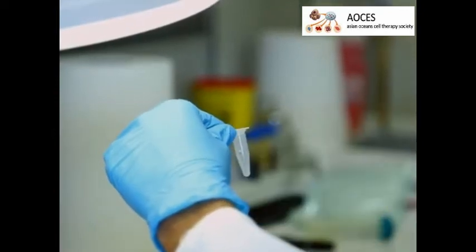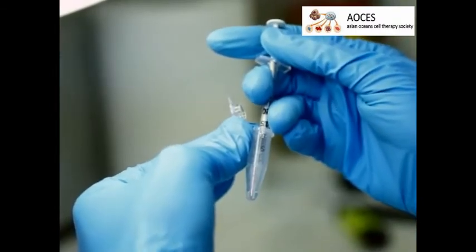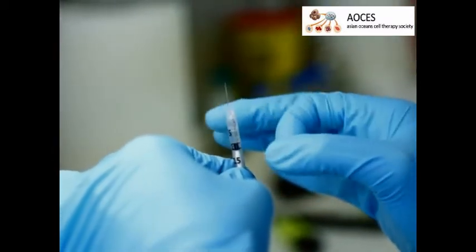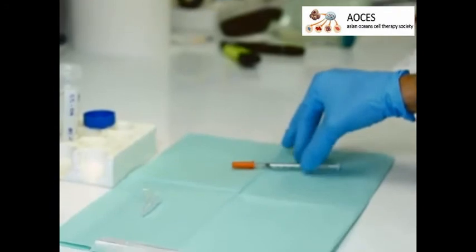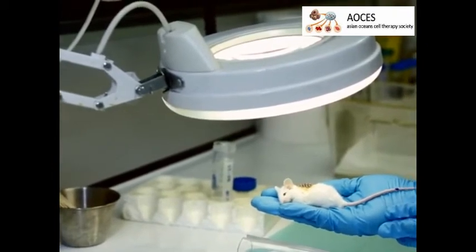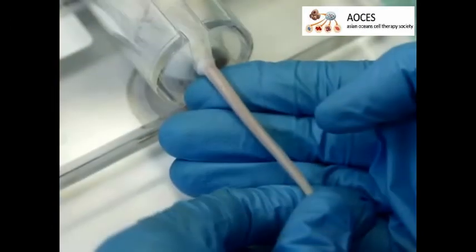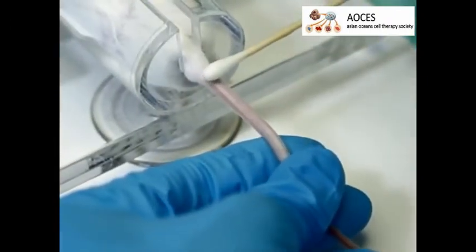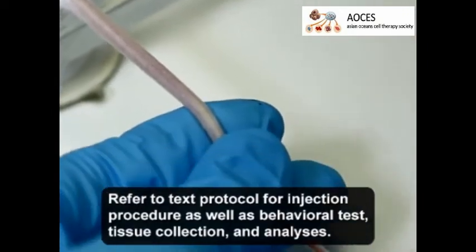To carry out a tail vein injection of cells, re-suspend the cells in the test tube and load 75 µL into a 0.3 ml syringe, ensuring that no bubbles are present in the cell suspension. To avoid cell sedimentation, keep the syringe in a horizontal position. Place the mouse underneath the heat lamp to dilate the tail veins. Then gently pull the mouse into the restrainer to visualize the lateral tail vein, which appears as a narrow blue line. Use an alcohol swab to clean the tail, and once the vein is visualized, grab the tail vein between the middle finger and thumb of the left hand.